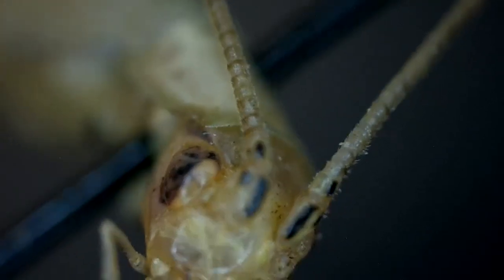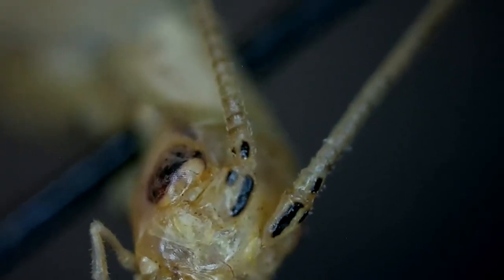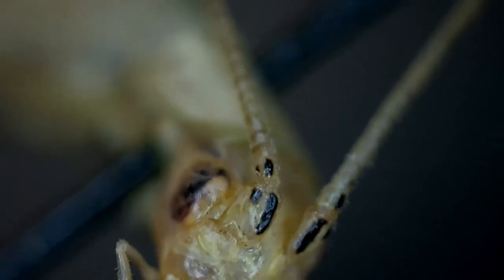Next is Quadrapunctatus — this is the most numerous tree cricket species I have. The key feature is that the dot on the first segment is not like a smear; it's more of a round, complete circle. The second segment is a lot cleaner as well. So essentially, any specimen with that first-segment dot looking like a complete circle rather than a large smudge, I put down as Quadrapunctatus.